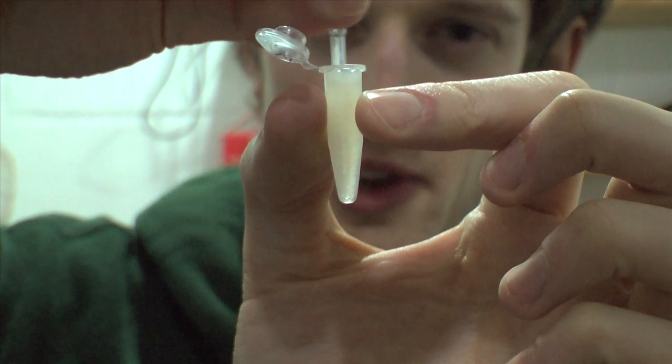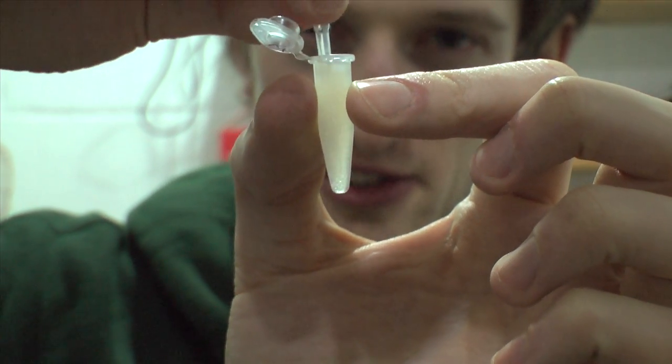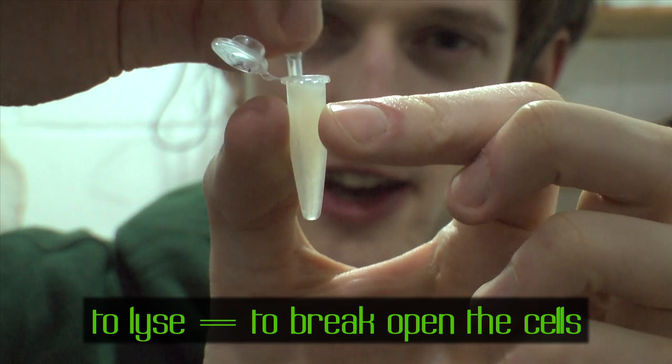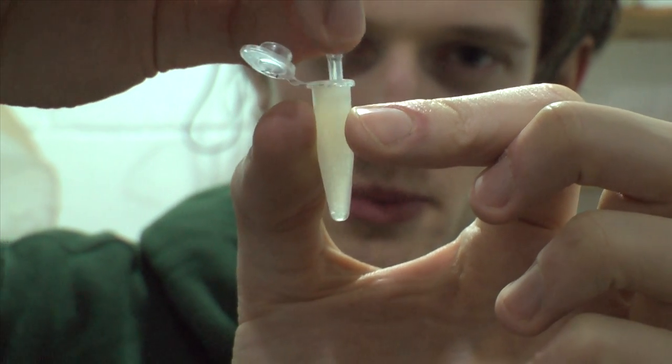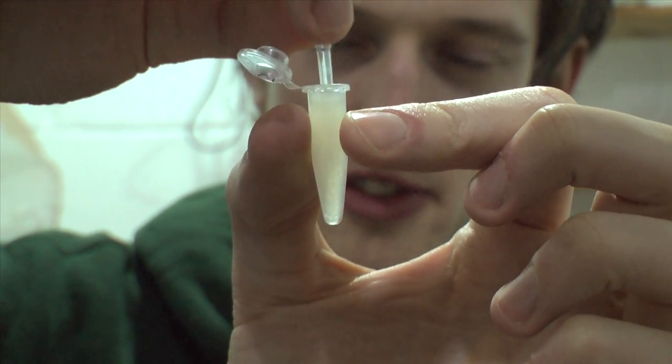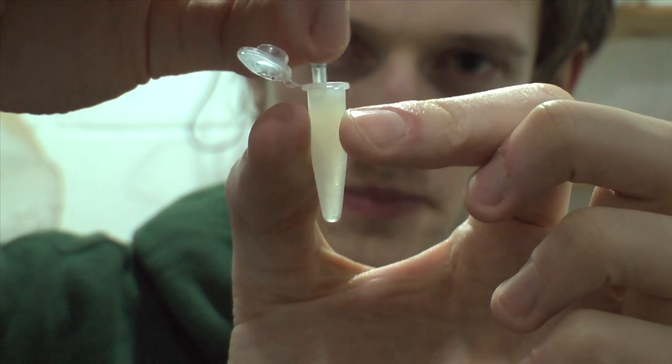This is a mixture of my cheek cells plus Chelex. And once they're mixed, we're going to boil it, which will lyse the cells, release the DNA, and the Chelex will prevent anything but the DNA from getting into solution.